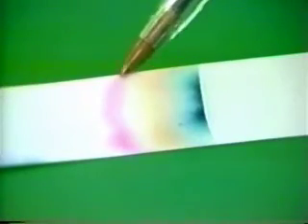With the passage of time, colors can be seen corresponding to different compounds in the ink. We have a red, a yellow, and a blue component, originally mixed to make the black ink.